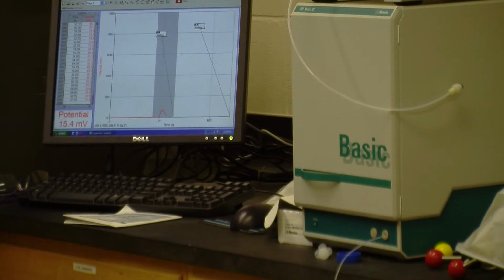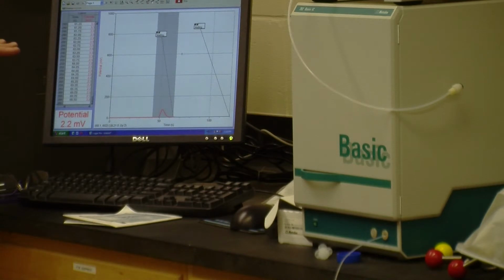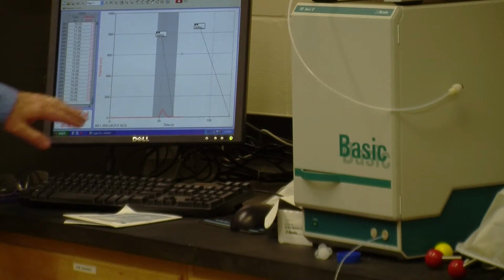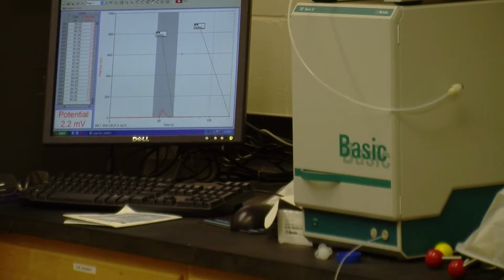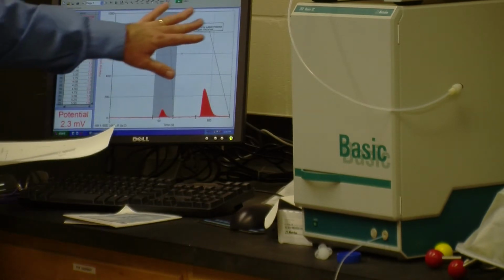So that's our oxygen peak. Now it is a little bit different in terms of timing, and that's because there's this manual bit where I have to come over and start the collection, but it should be around 50 seconds under these conditions for the oxygen, and it should be around 100 seconds for the nitrogen. And there's our nitrogen peak, and they're the respective areas.